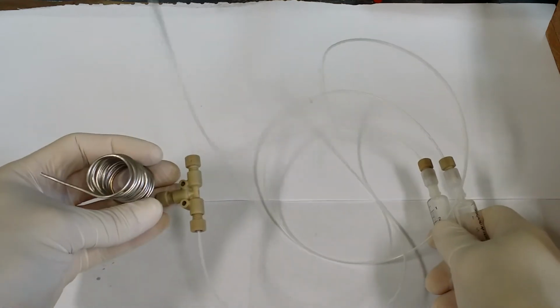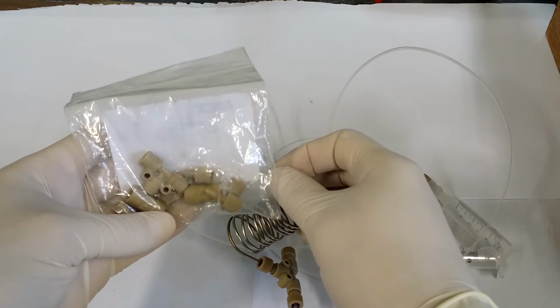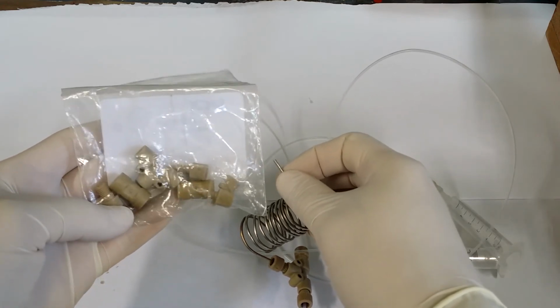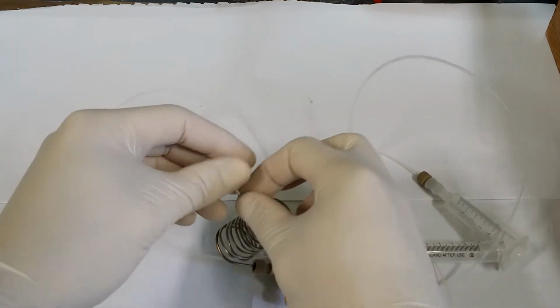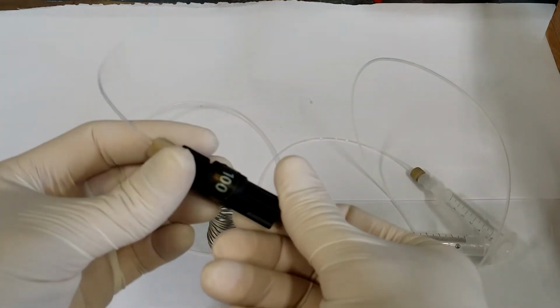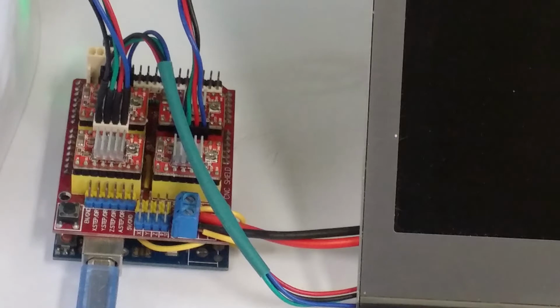This way, the syringe pumps can be far apart from the reactor. You can find the fittings that I use in this video from IDEX Health and Science. These parts are a really big help when building your flow chemistry system, and I highly recommend using them. It is possible to run these reactions at temperatures higher than the standard boiling points by using a pressure regulator, like this one. At the heart of this flow system is an Arduino Uno compatible microcontroller.